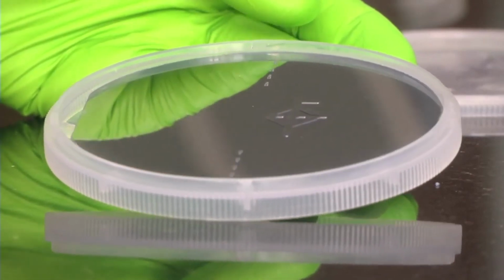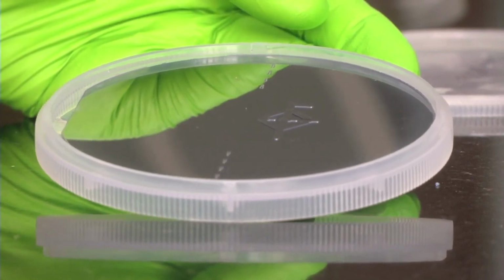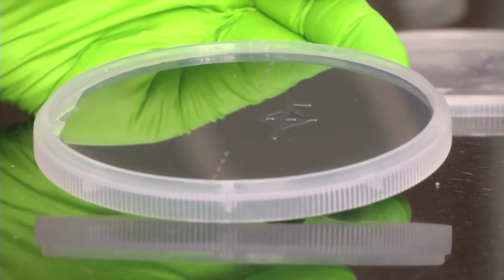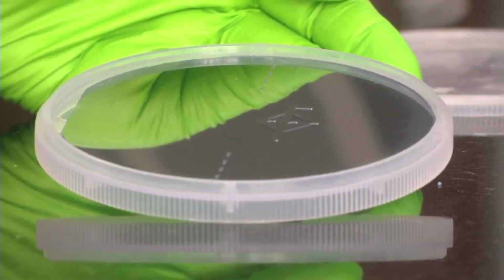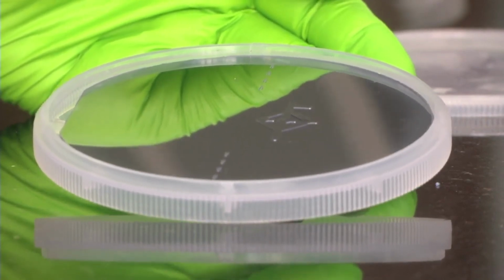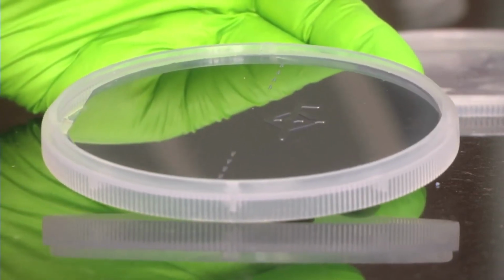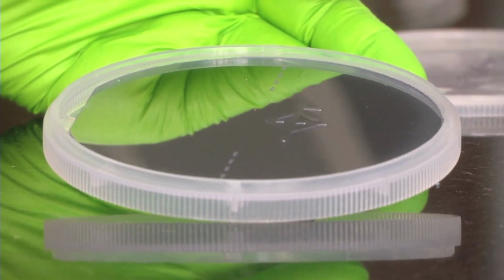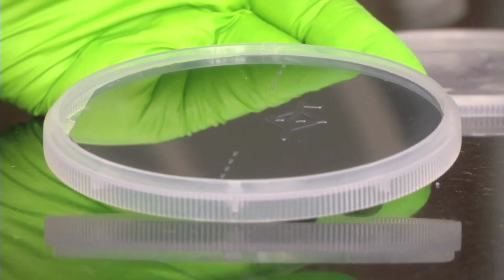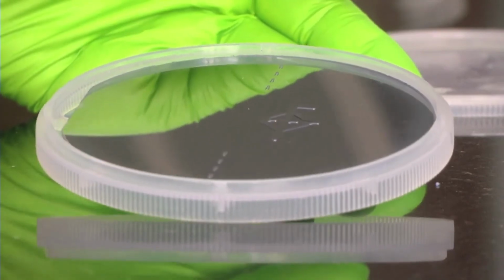How was this silicon master made? We took a normal p-type silicon wafer, which usually is around 500 microns thick. Then we deposited an oxide layer on top. After that, we did photolithography of this pattern. These are the microfluidic channels, and now they are coming as elevated structures. These will come as channels on the PDMS, because the negative of this will form on the PDMS. On top of this we will pour PDMS.